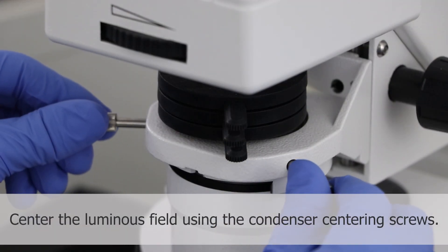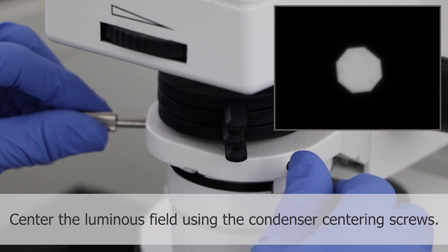To center the luminous field, adjust the X-Y position using the condenser centering screws.